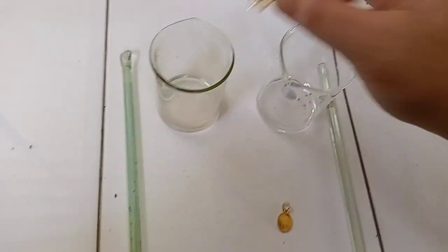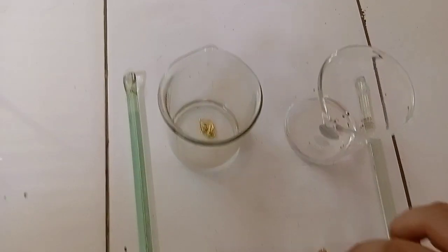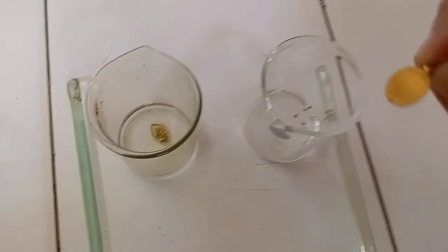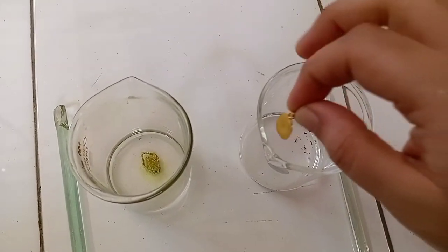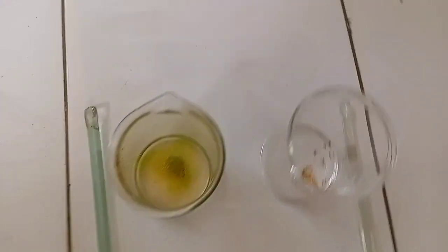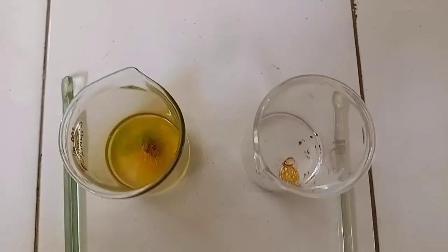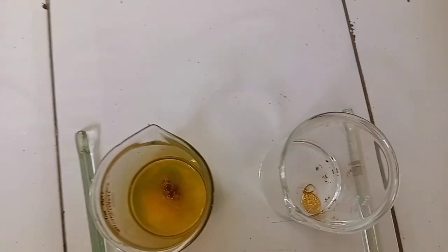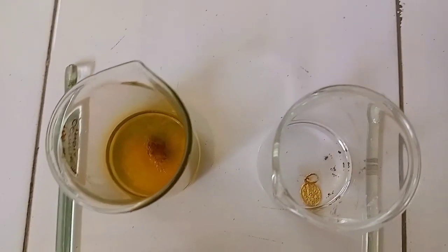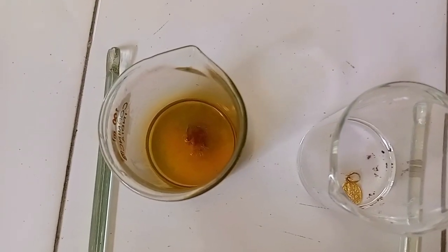Now I am introducing the samples we have taken to the beakers — one in the first and the second one in the second beaker. Now you can clearly observe some kind of yellowish fumes from the first beaker.